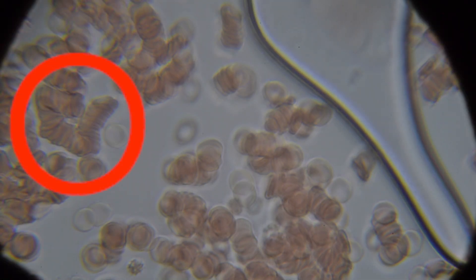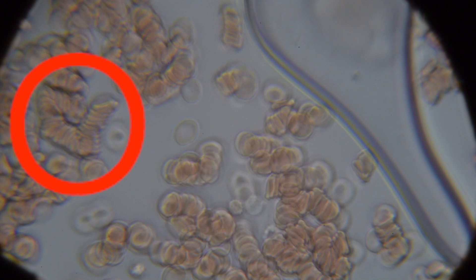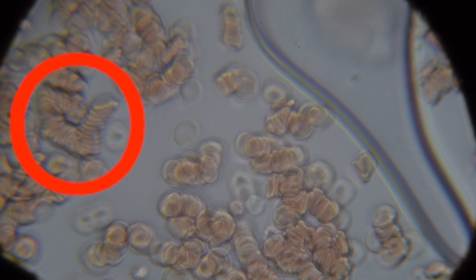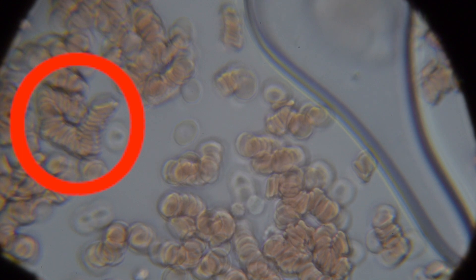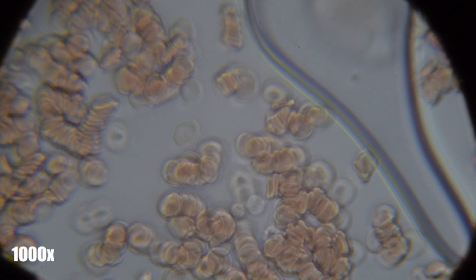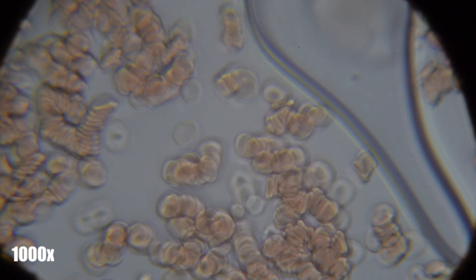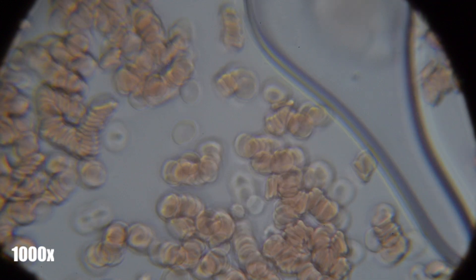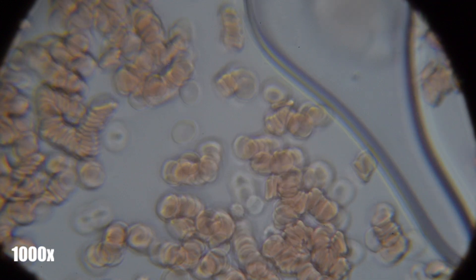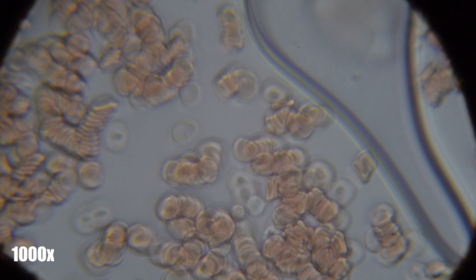These stacks of red blood cells, seen here, are in a Rouleaux formation, and are not usually a sign of anything good. The presence of these formations can indicate chronic diseases, or acute illnesses, such as infections. We'll be consulting a doctor for further investigation on this matter.